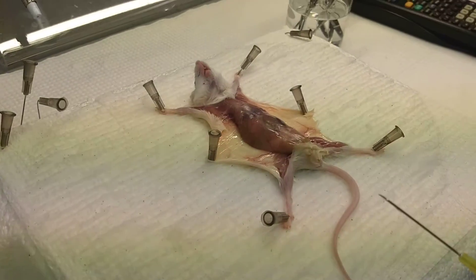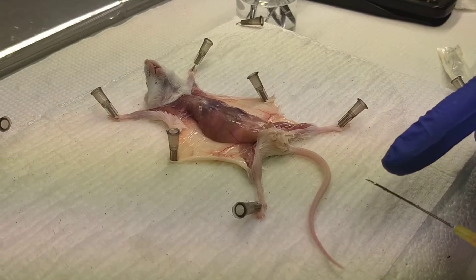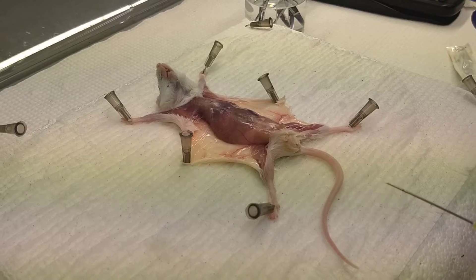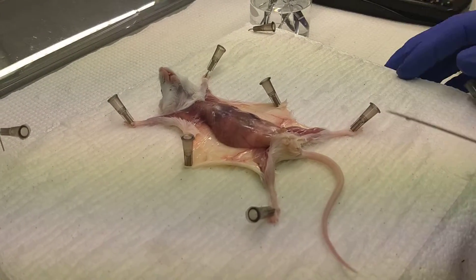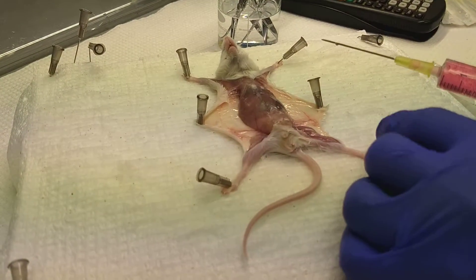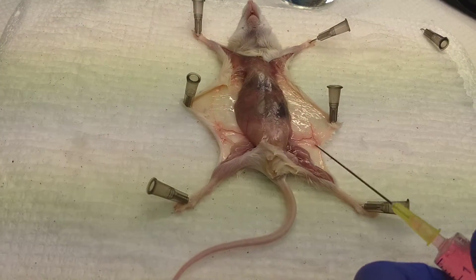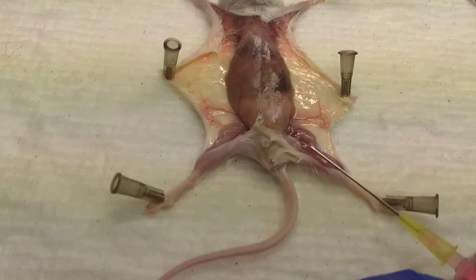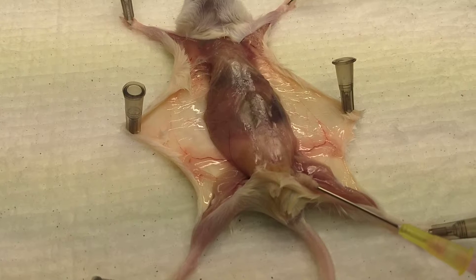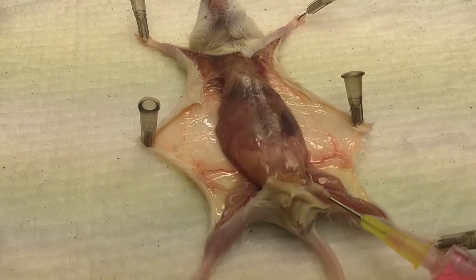You're going to inject the media along the leg, making sure that the opening of the needle is pointed outwards. The sharp point of the needle should be facing more towards the body and the opening farther out. You can inject just left of the femoral artery. You have to go in and then lift a little bit up because you'll hit part of the pelvic bone — that's okay, just as long as you don't hit a vein and cause bleeding into the peritoneum.